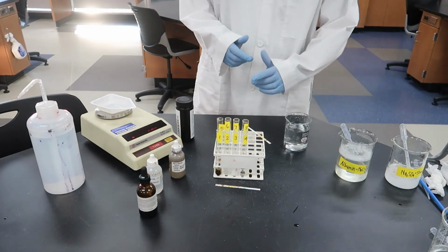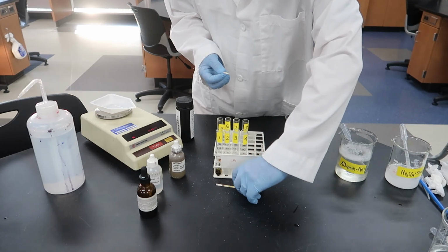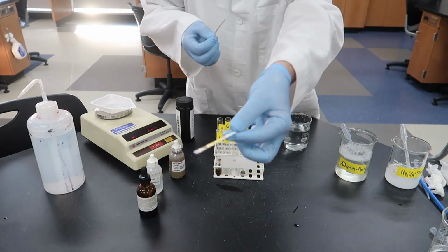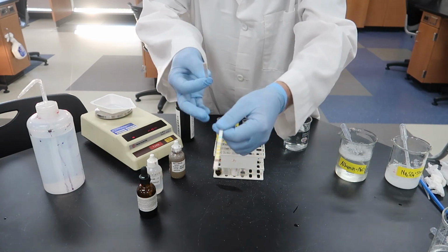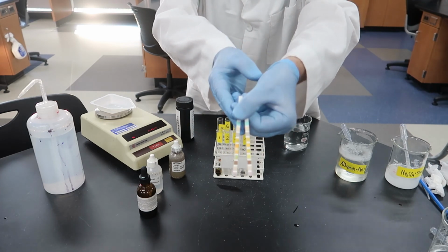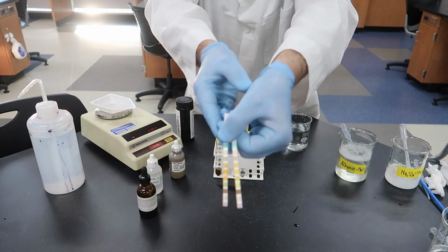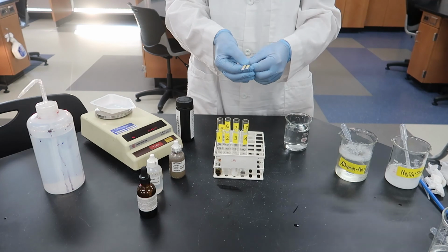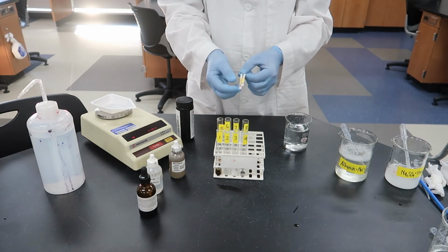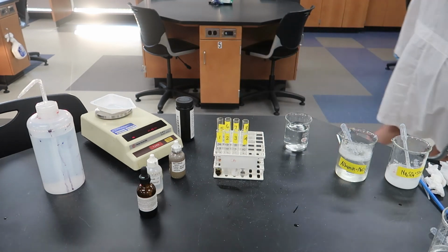And we're back. It's been about 5 minutes, and we can now take a look at these strips and look for a change. The strip that was on the front was from test tube 4, and that still looks pretty yellow. The test strip from the back, from test tube number 8, looks green. It's kind of blurry, it's hard to see there, but I think you can see the color difference fairly well. Alright, at this point you have the data, so it's now up to you to interpret what your test tubes told you and figure out what all of this means in terms of diffusion of materials.